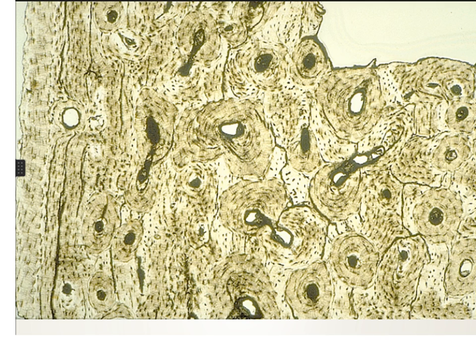In this picture, you may have a label for these white or black circles; these are the Haversian canals and not Haversian blood vessels. It is a calcified tissue, not a living tissue. In the ground compact bone, we have the calcified tissue, so it is the canal which normally contains the Haversian blood vessel. But the Haversian blood vessel cannot be seen in this picture. We only see the room which is the Haversian canal.